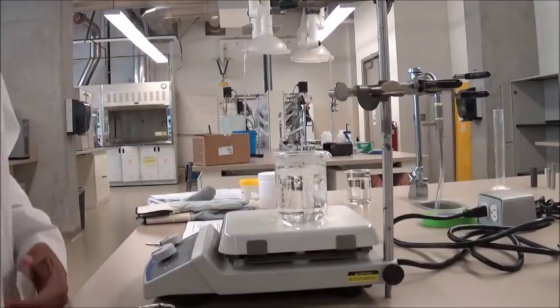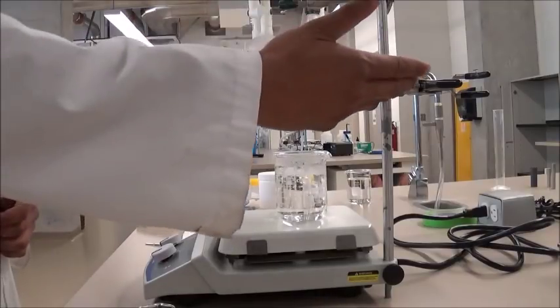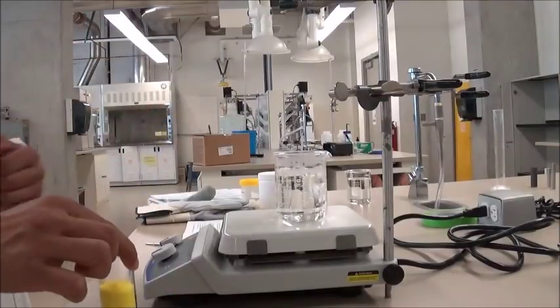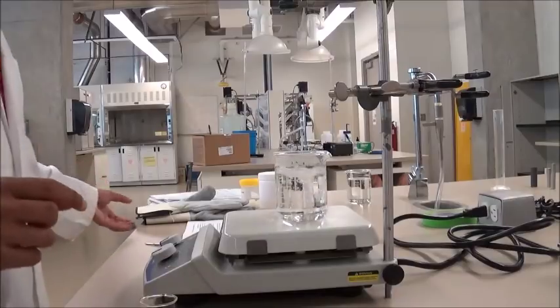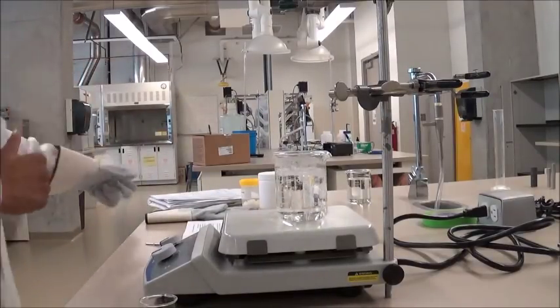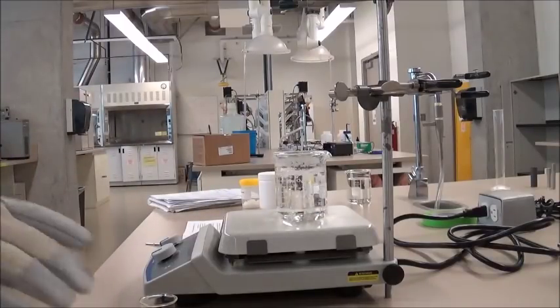Once you see that the water has started to boil or has started to really heat up on the hot plate, we're going to place it on these clamps over here, and then we're going to submerge this beaker into this water bath such that we can melt this 9-fluorenone. To do that, we're first going to wear heat-resistant gloves because the air around this hot plate is quite hot and warm, and we don't want any burns.